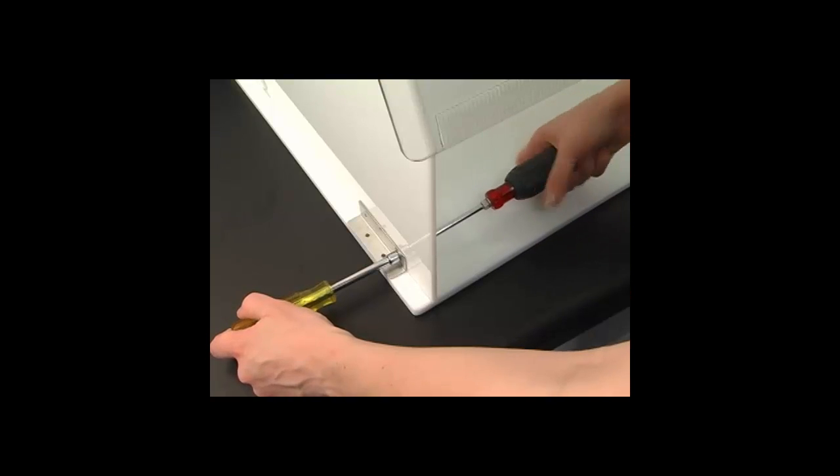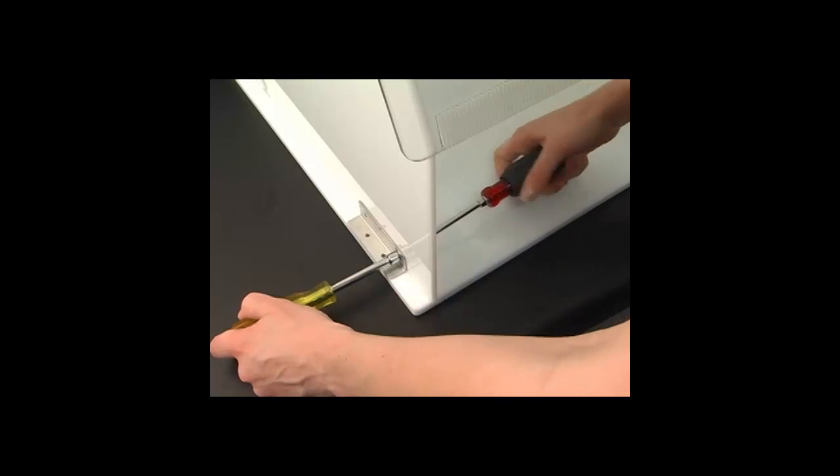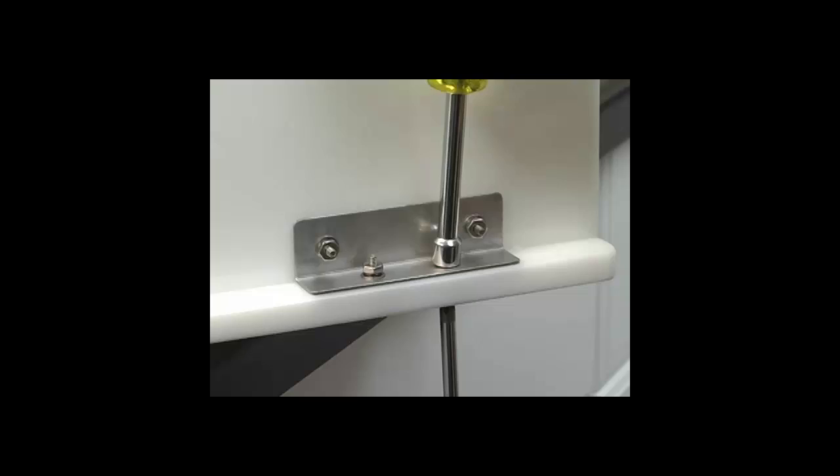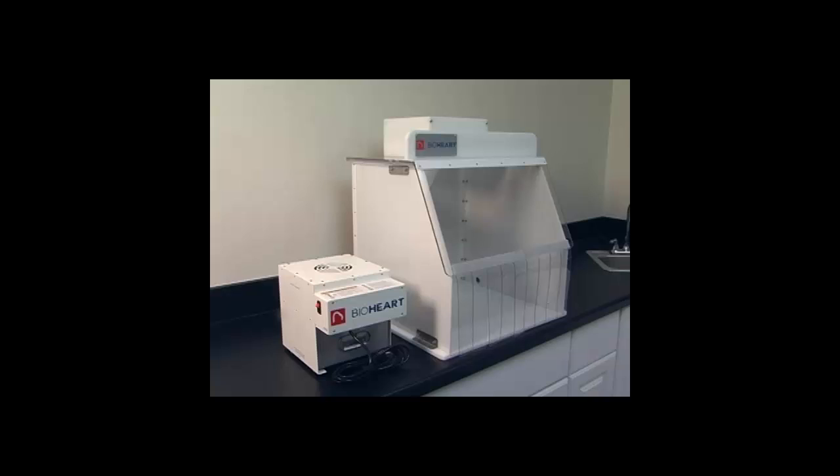Once you have installed all of the hardware, tighten the screws with the screwdriver and nut driver. When you are finished with this step, make sure all the brackets are in place and tighten down securely. It is important to verify this step before proceeding with the rest of the installation.